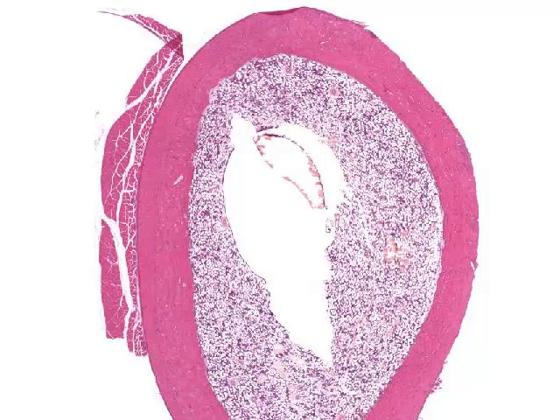First, however, let's just get oriented very quickly on the slide. So the shaft of the bone is this dark pink staining material. The arrow is following around here, and the central core here is the medullary cavity or marrow cavity of the bone. The material which you can see which stains here is bone marrow, so it's a mixture of adipocytes, fat cells, and blood stem cells, which give rise to all the cells that you find circulating in the blood. Just for your information, the material which you see adherent to the outside edge of the bone here is striated skeletal muscle, which we'll be looking at in a future practical.